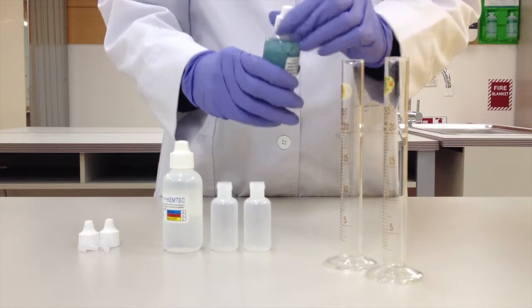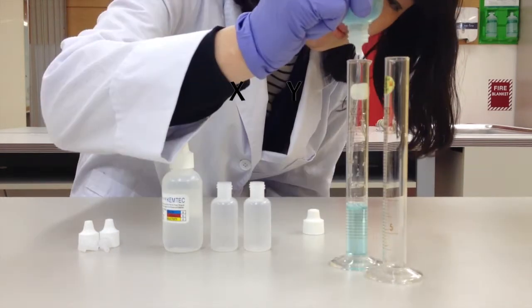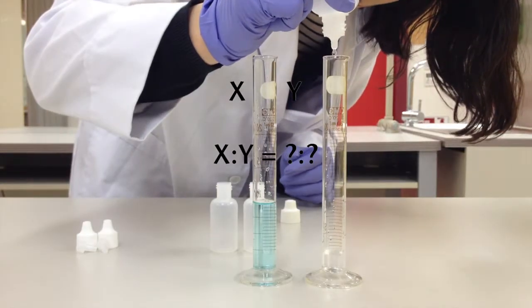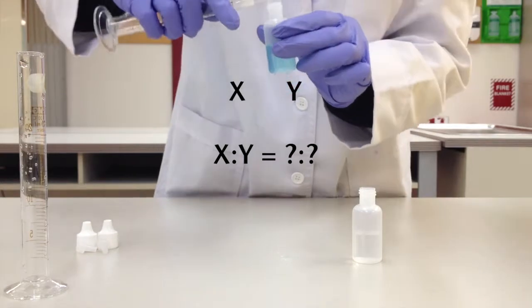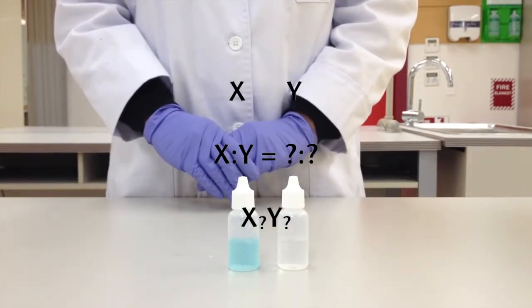In this lab, we're going to combine two chemicals, X and Y, which Miss Jo is preparing for us right now. Our question is, in what ratio do these two chemicals combine to form a new substance? If we know the answer to that, we can then write the empirical formula for that new substance.